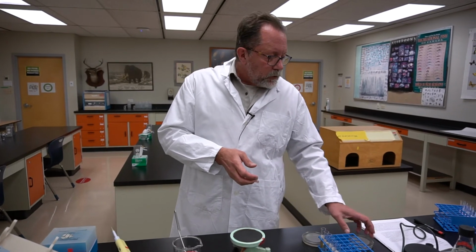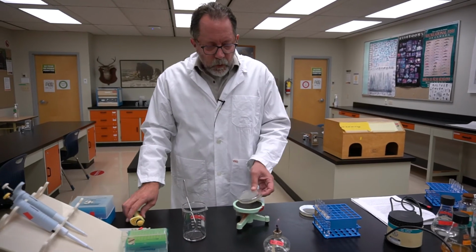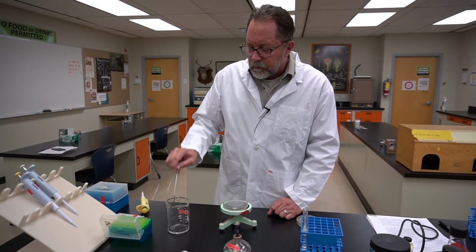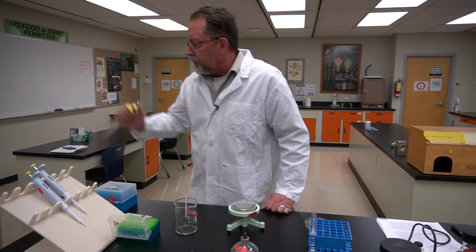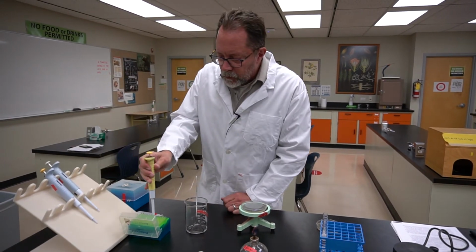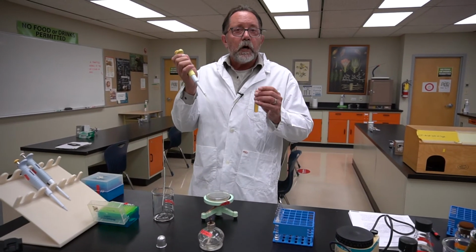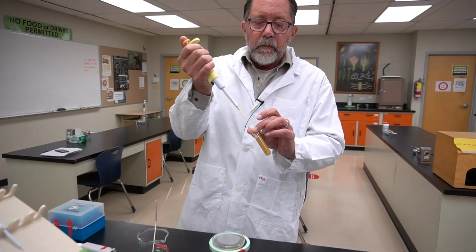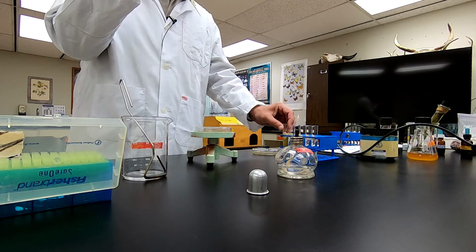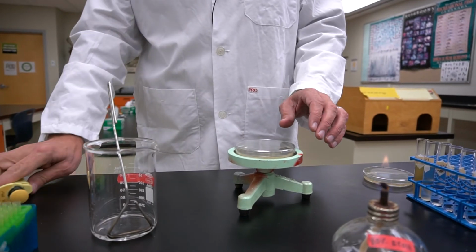Now, just to show you, on the His minus plate, I'm going to do the same kind of thing. So I'll do this in the proper order this time. Get rid of the tip and mount a new one. Now this time I'm going to take the 10 to the minus 1 concentration, take out 100 microliters, put it on the plate, squirt it into the center.